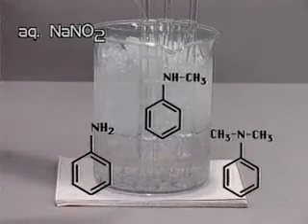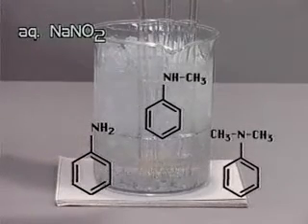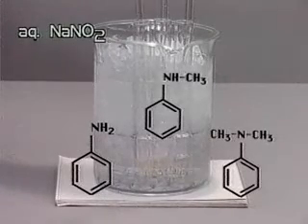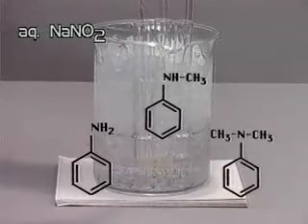Aniline, a primary amine, N-methylaniline, a secondary amine, and N-N-dimethylaniline, a tertiary amine, are placed in separate test tubes.